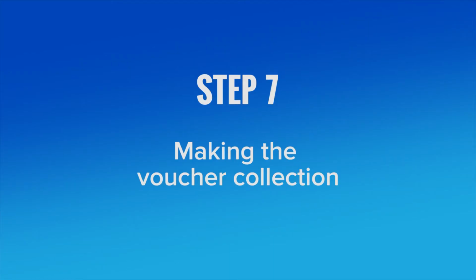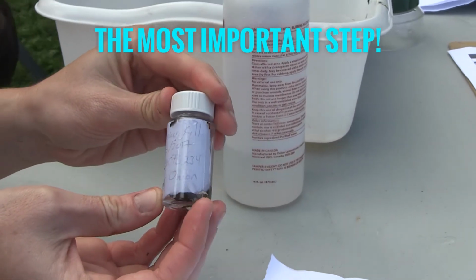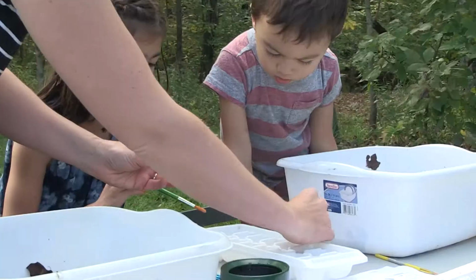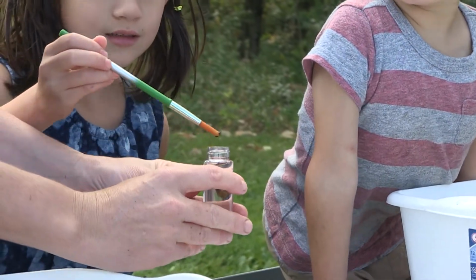Step 7. Making the voucher collection. This is the most important step of the entire process. The most important step. Fill a sample vial with 90% isopropyl alcohol. Next, place 1 or 2 specimens of each macroinvertebrate type you found into the sample vial.